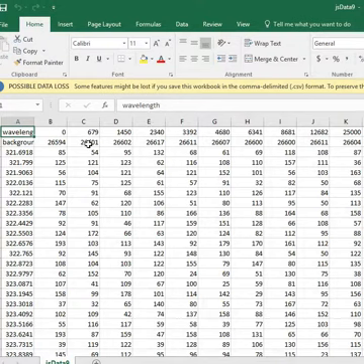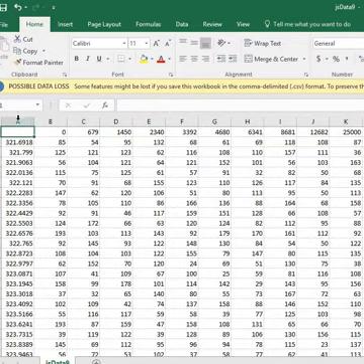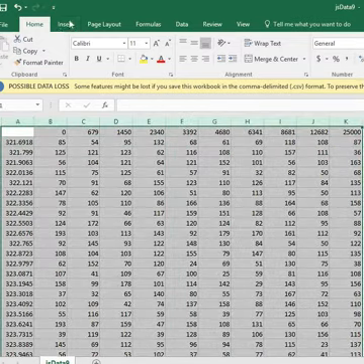What we have across the top are the time delays in milliseconds. The first one was acquired without a delay. The last one was acquired at 25 seconds, which is 25,000 milliseconds. We get an estimated background count that's been subtracted from all our other data. So let's get a graph here. First of all, we're going to get rid of the cell that says wavelength. We're going to get rid of this whole row. And now let's take a look at the spectra.